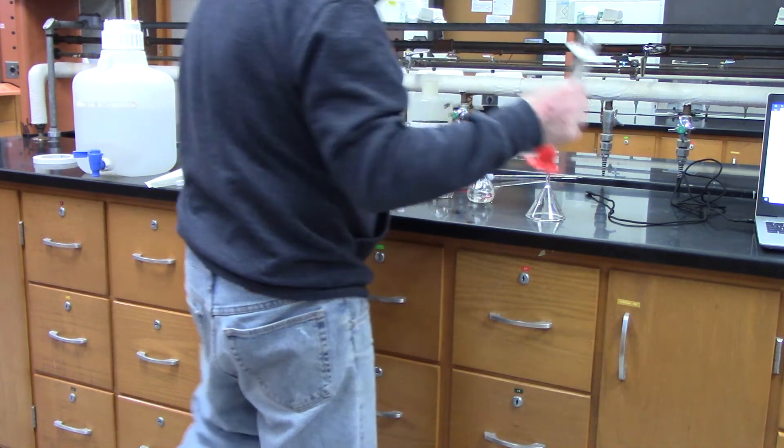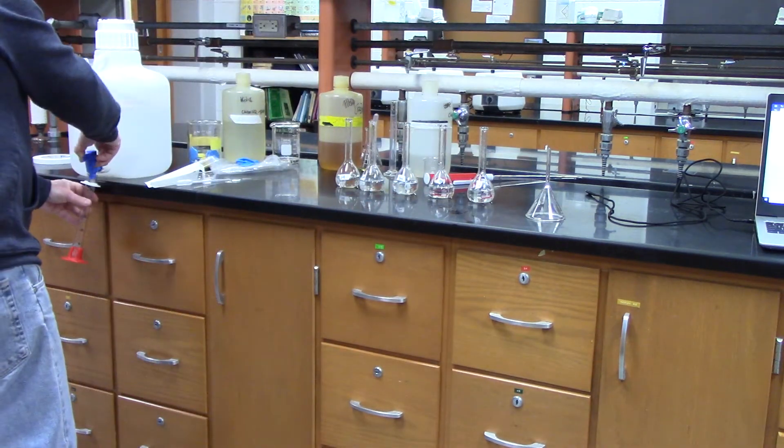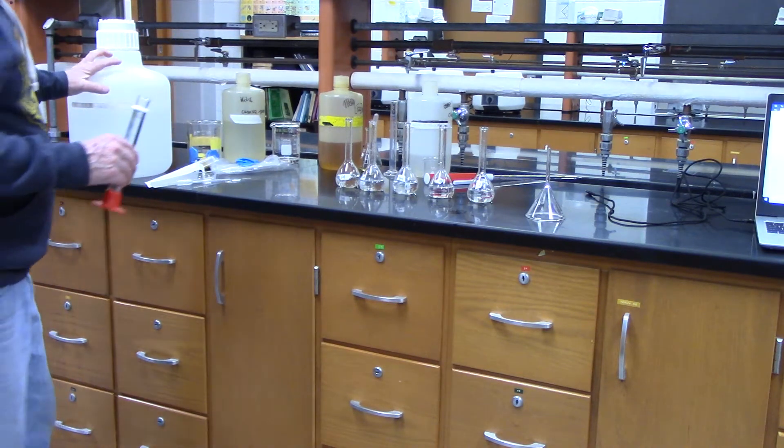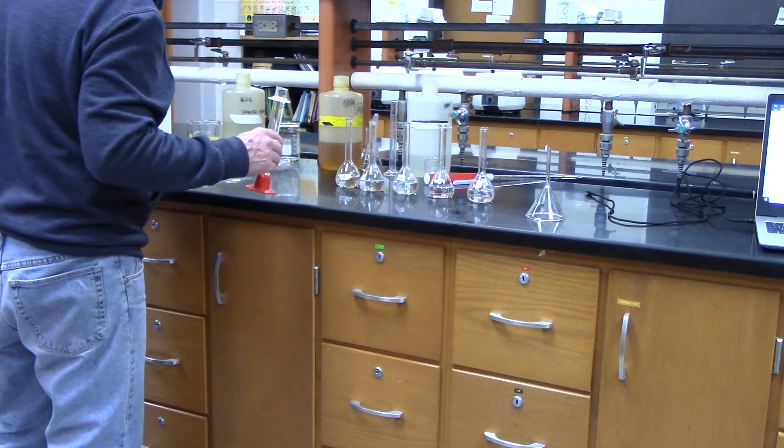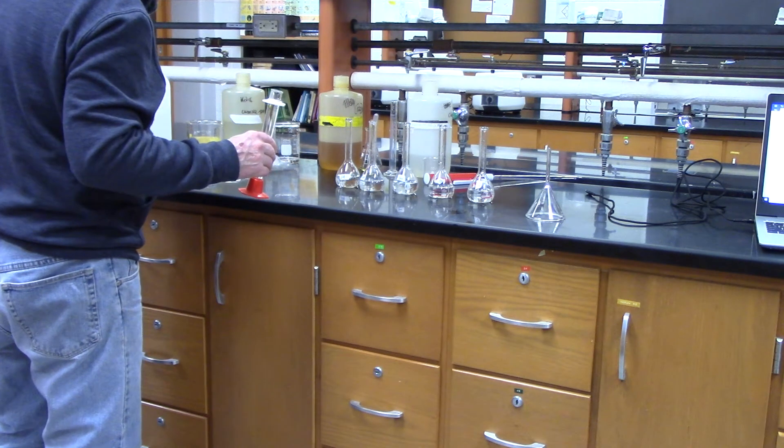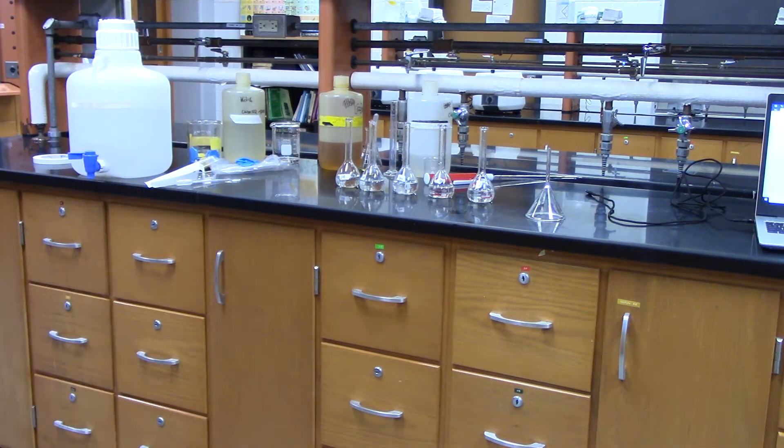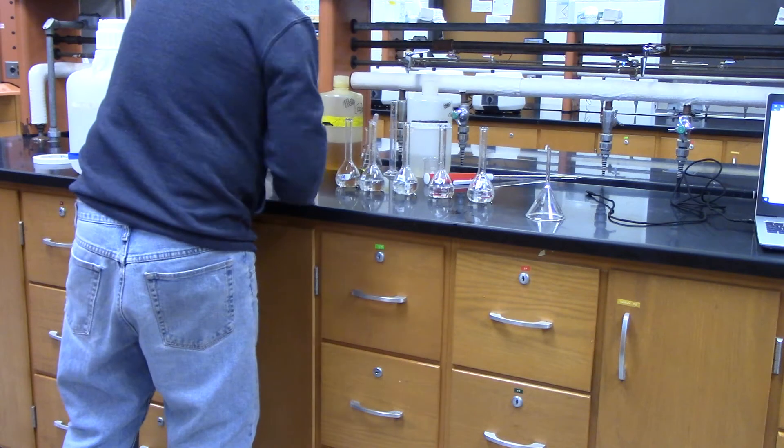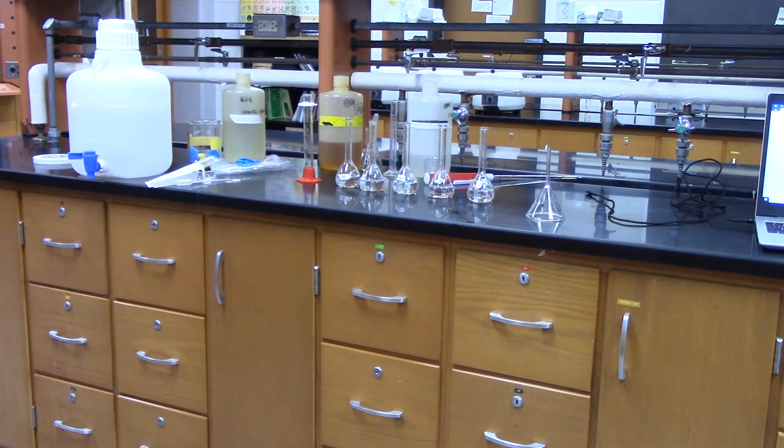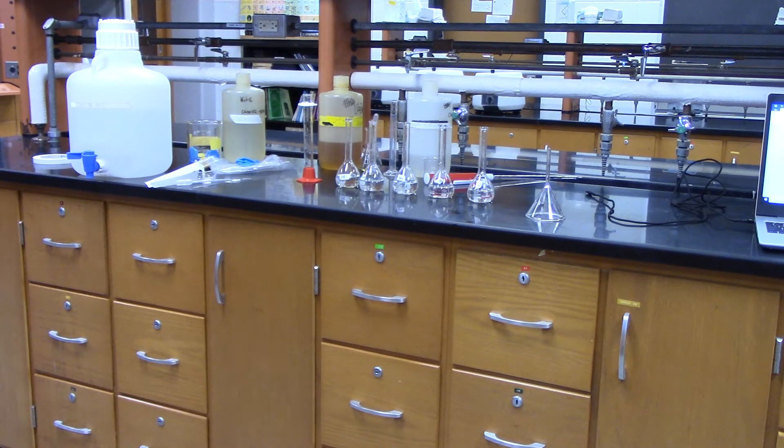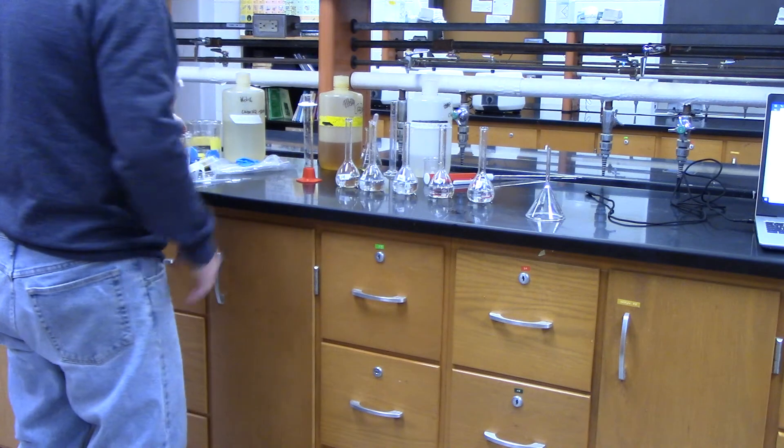All right, I'm going to rinse this guy out with my nitric acid. So I just, we have our nitric acid. Okay, I'm going to pour this out. All right.